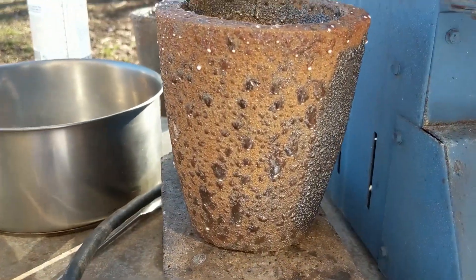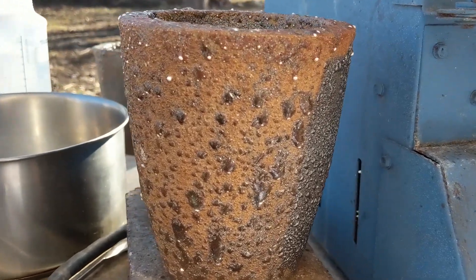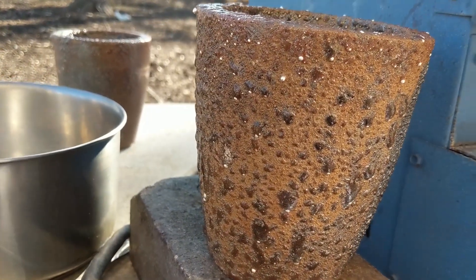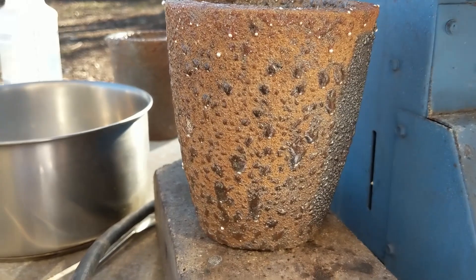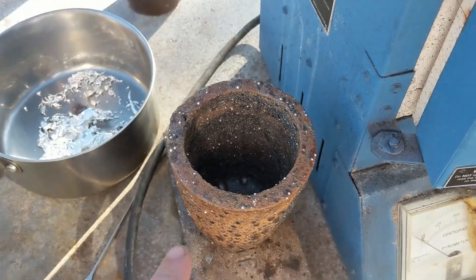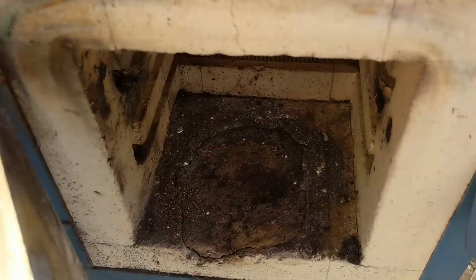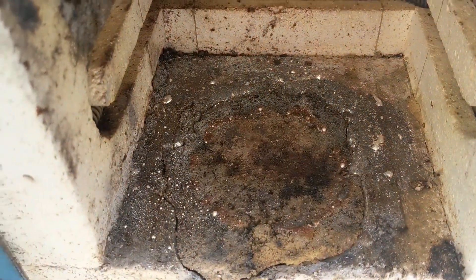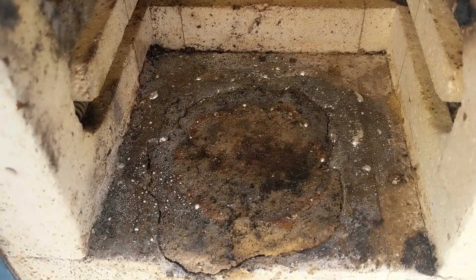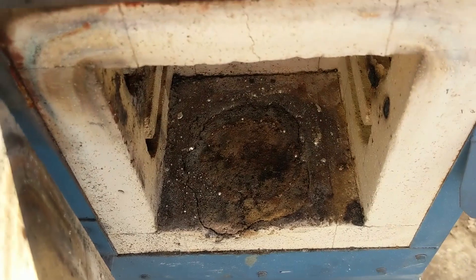Another thing to note is that I had a little accident with my silver — you can see silver BBs all around my crucible. The silver nitrate wasn't completely dry, it still had some moisture in it, and it boiled over and boiled down and it's even got a little bit in the bottom of my kiln. So I'm going to try to clean the stuff at least off the bottom here as best as I can before I fire it back up.